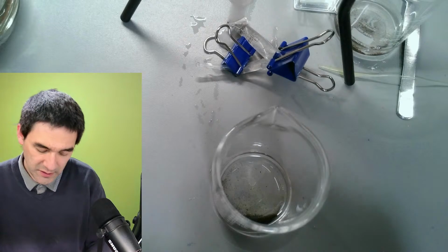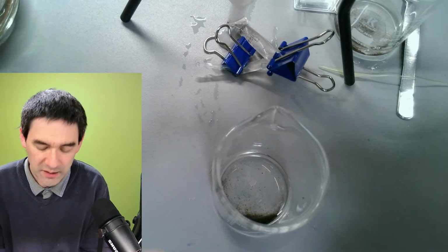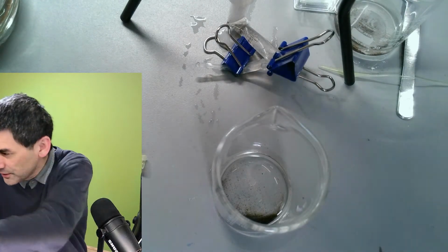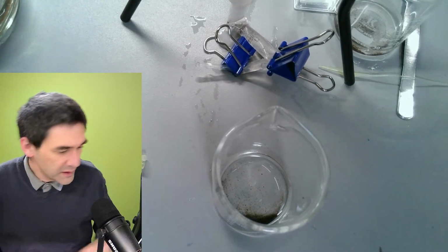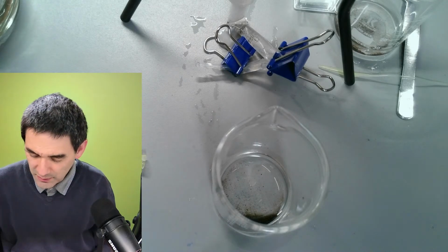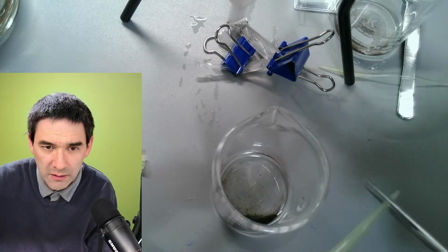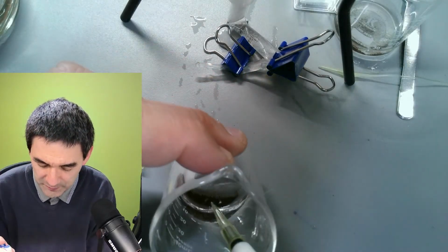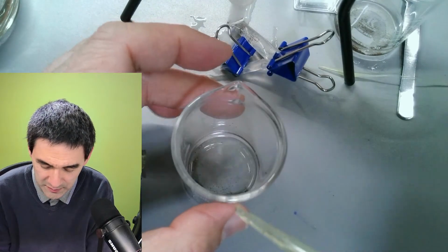Yeah. So let's have a look. I'm going to change this tip here again, and I'm going to remove this here again. Just a second here on the top, and let's give it another try. Okay. So I'm going to cut off this tip again, so that it's easier for me to take up some of the material here.